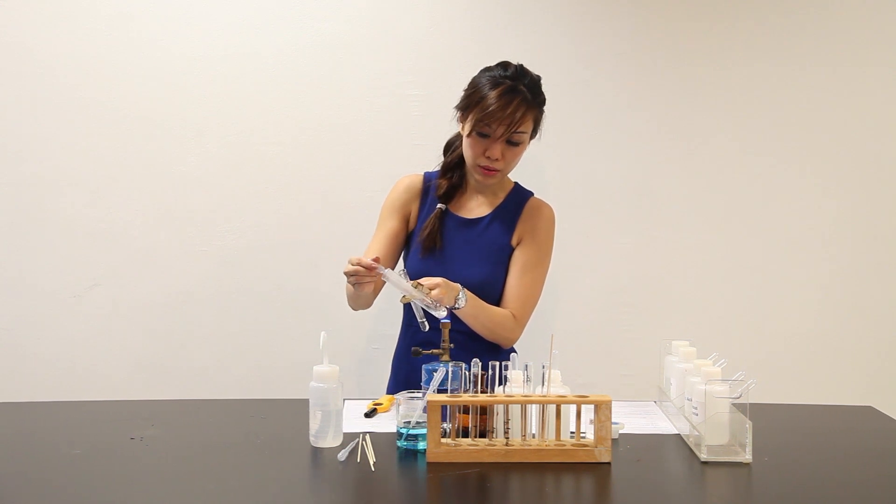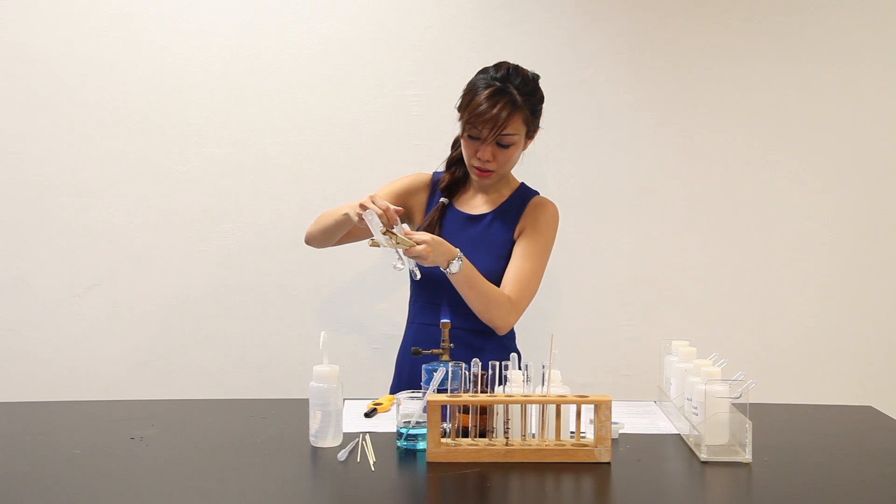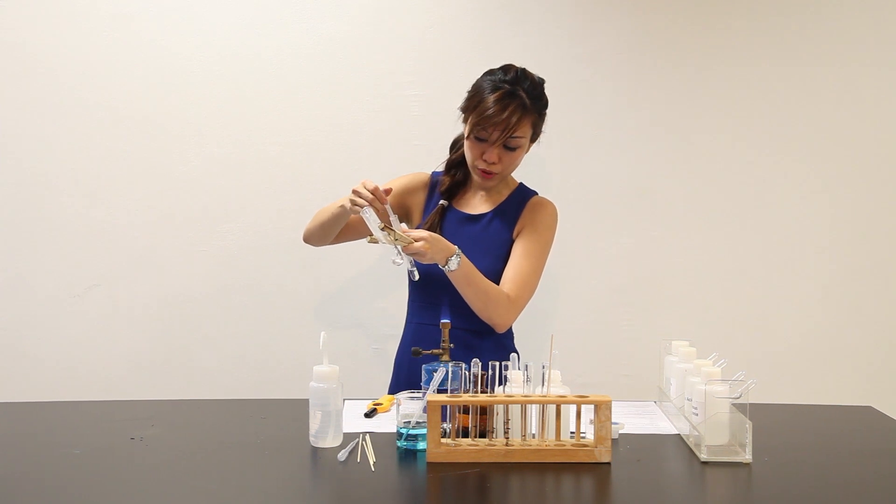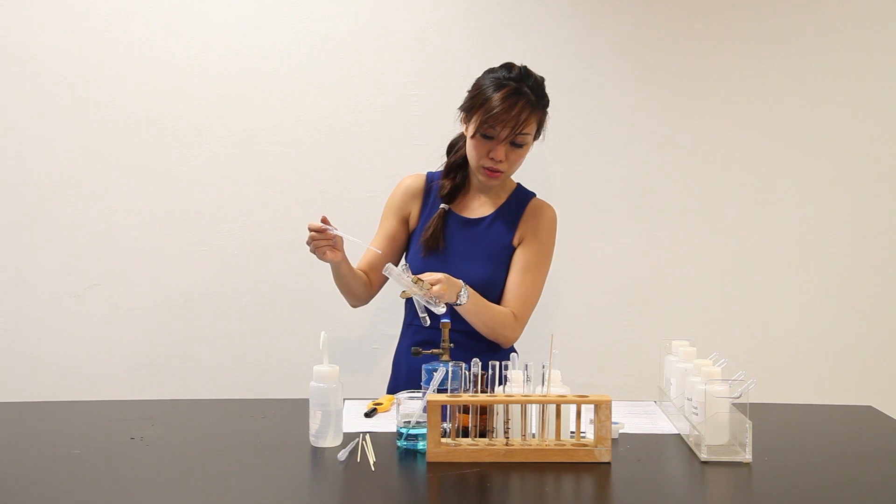Squeeze the gas out. Put through. Count one thousand, two thousand, three thousand. Pull it out. Bubble through. You have to repeat this entire thing for several minutes. So, let's be patient.